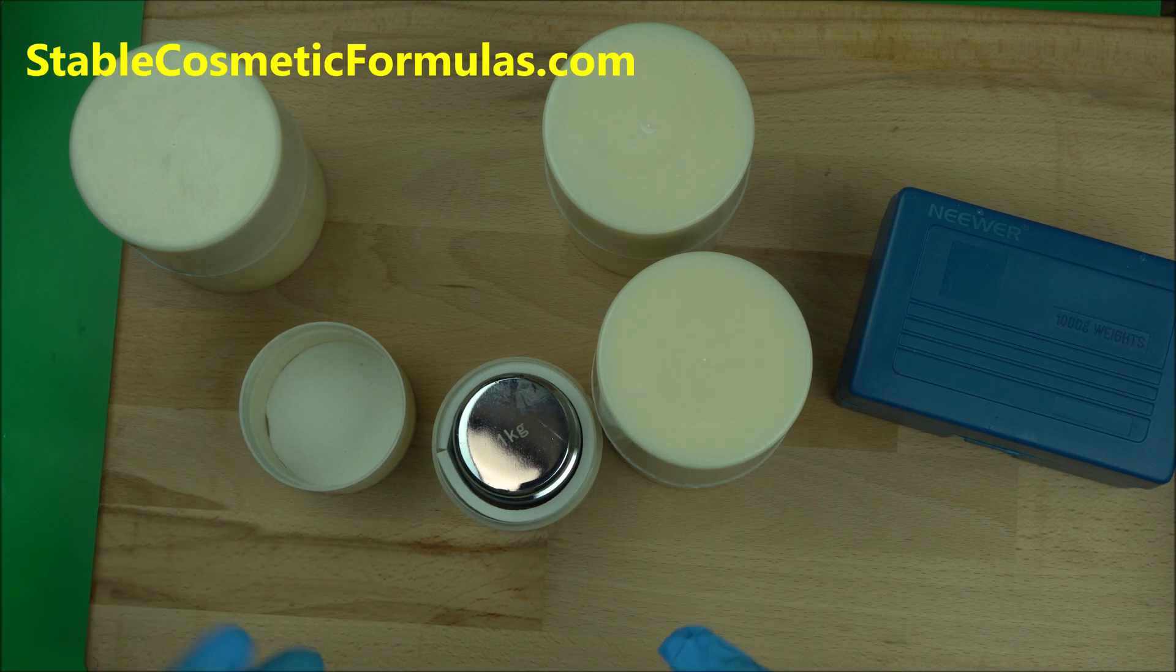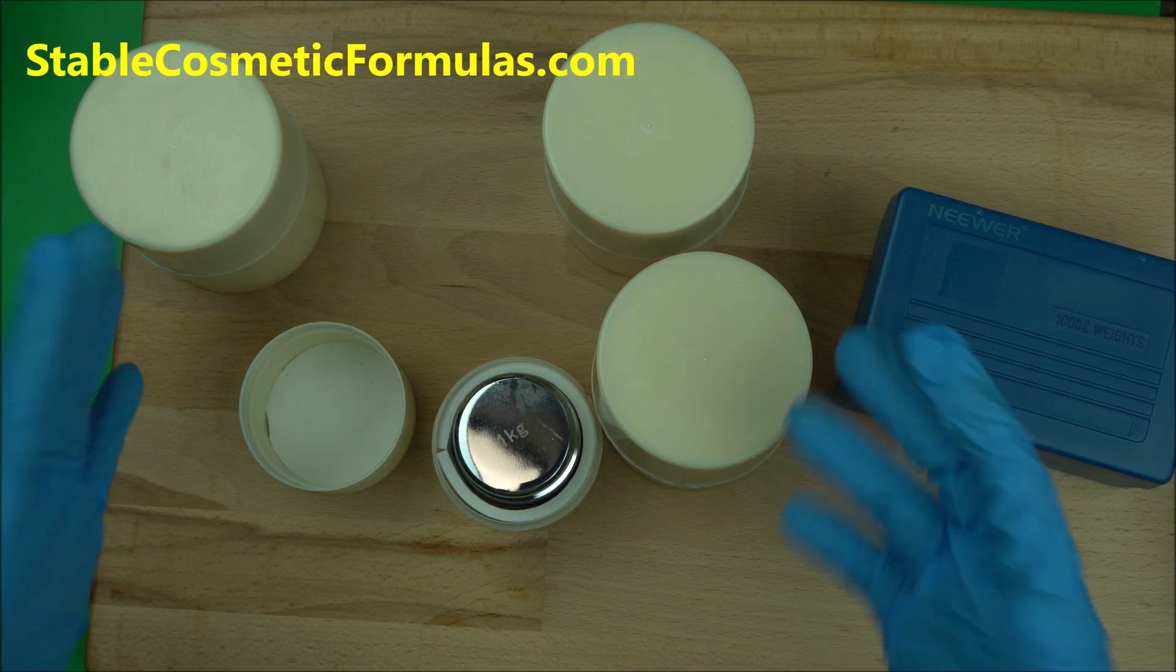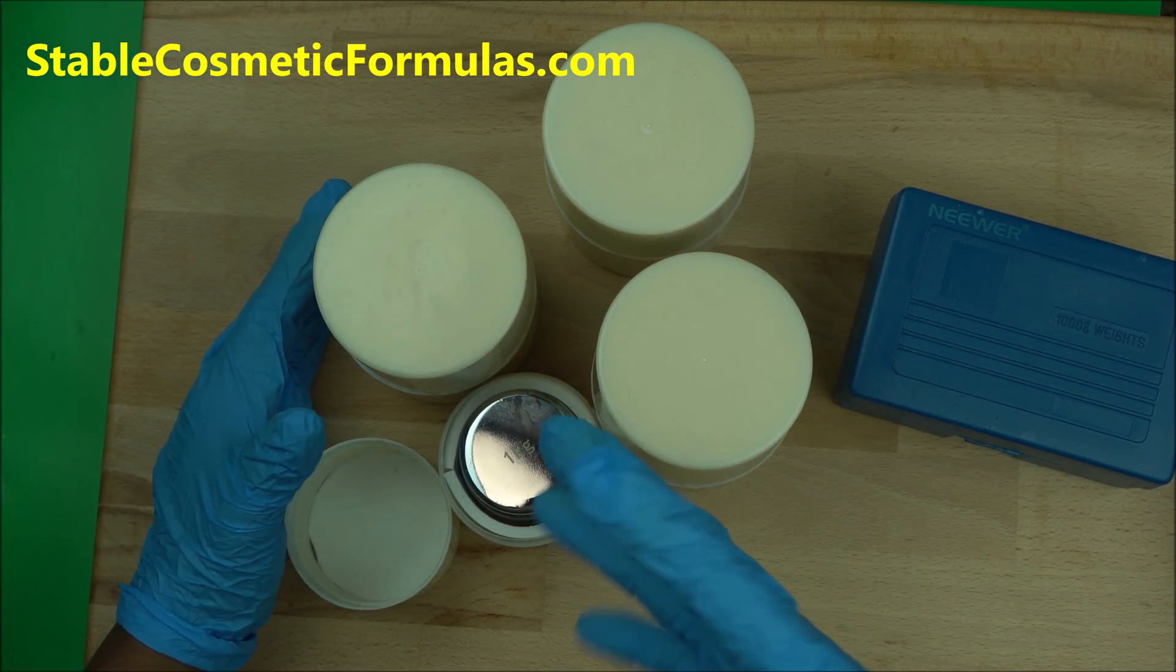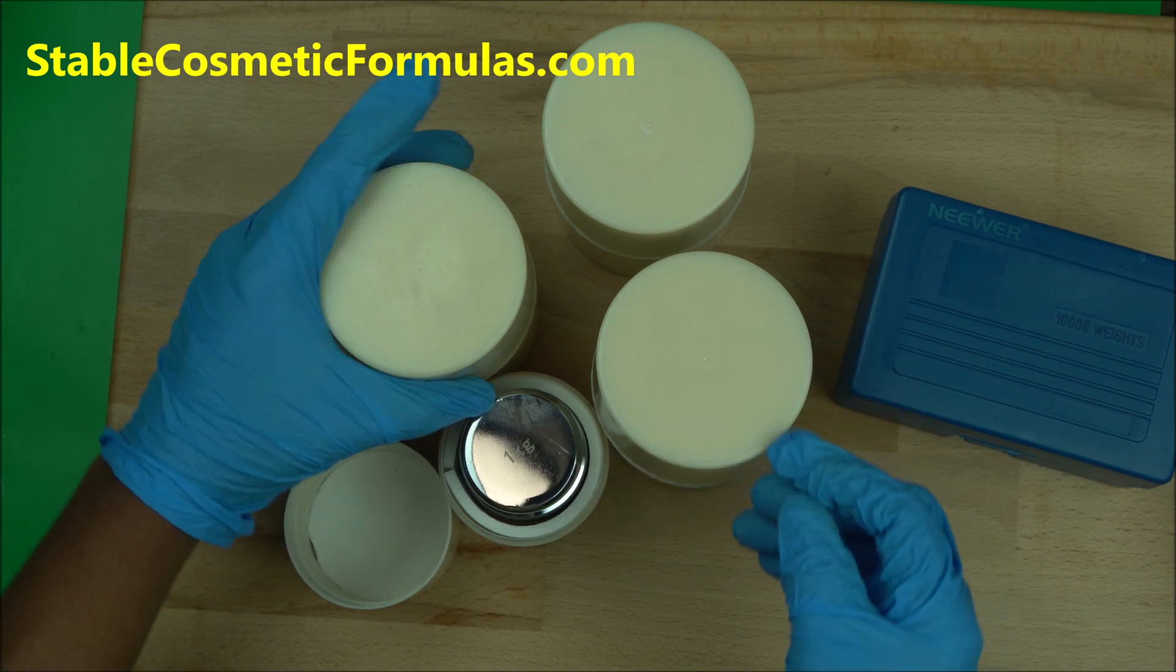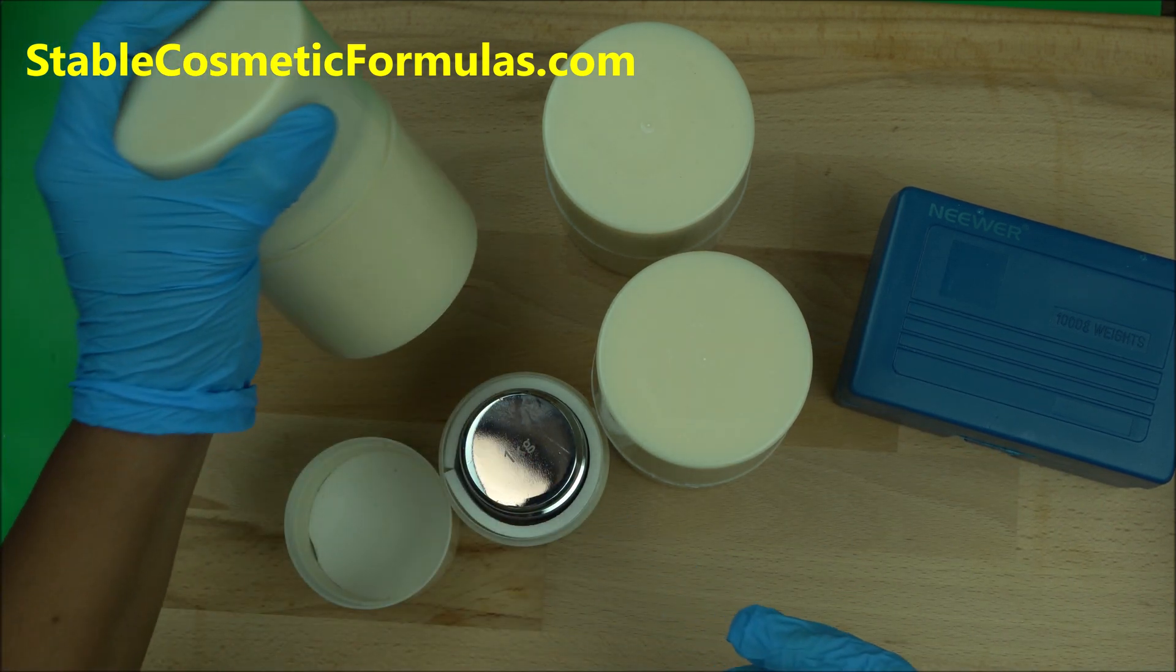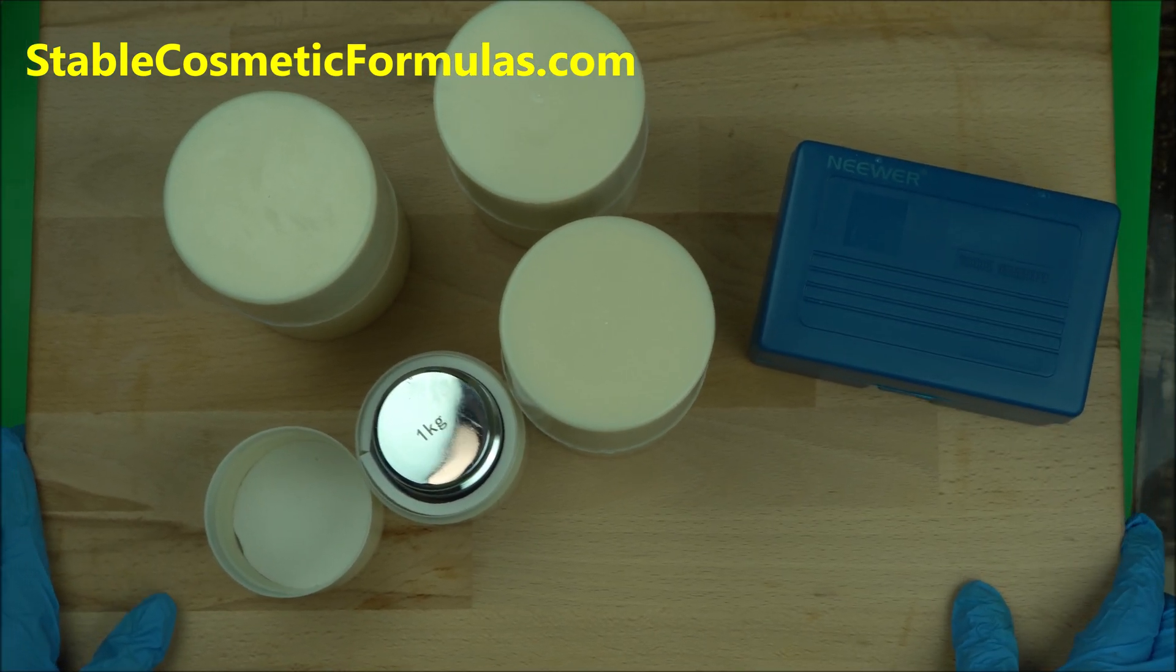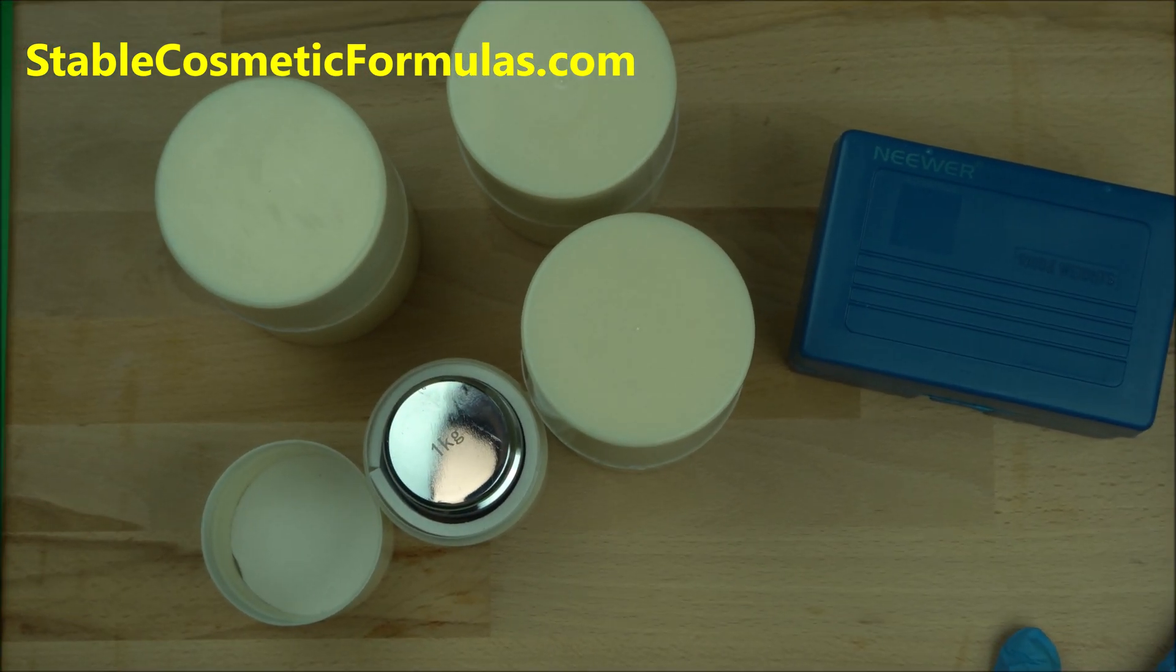Before you use it every day, why do you have to calibrate your scale in the lab every day? We calibrate our scale so as to have accurate readings. And as you all know, calibration weights are so expensive. Right now there are tons and tons of calibration weights out there.